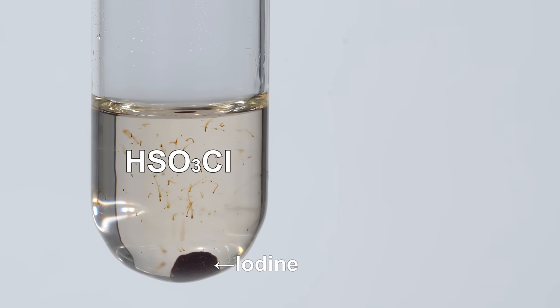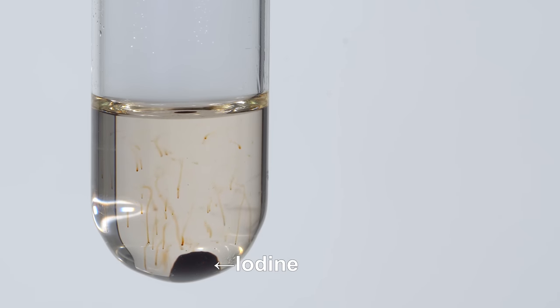Iodine dissolves slowly in chlorosulfuric acid to give a reddish-brown conducting solution.